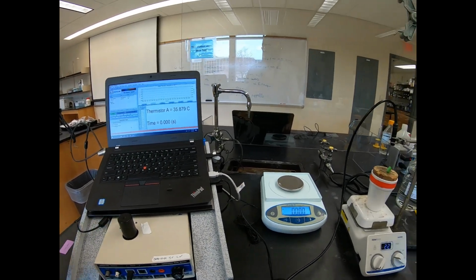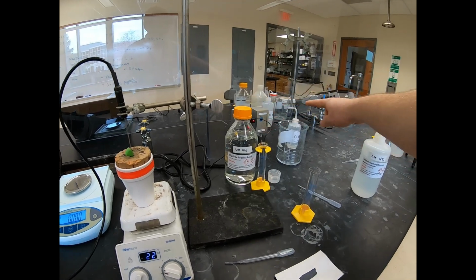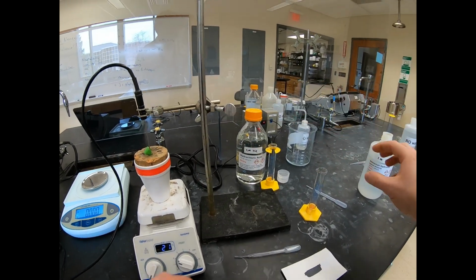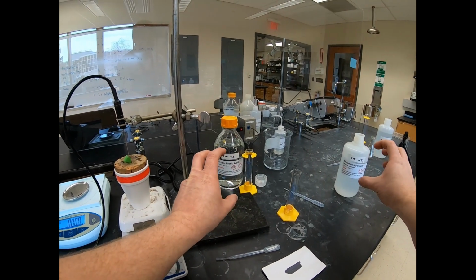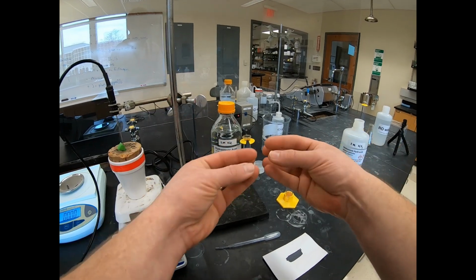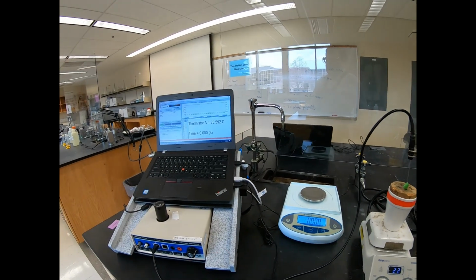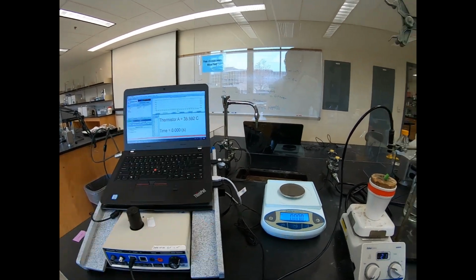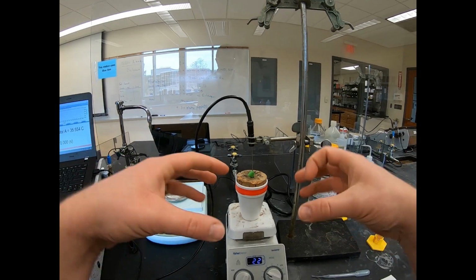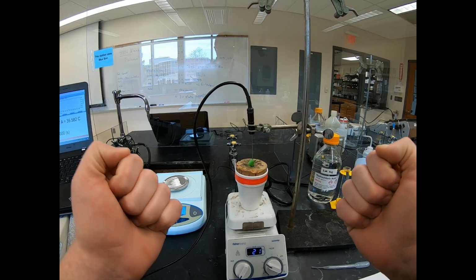So keep in mind that beforehand there's energy in the bonds of our two reactants, the ammonia and the hydrochloric acid. It takes energy to break those bonds, and as they reform new bonds, energy is released. In this case, we see that our temperature went up overall. So what that means is that there was a net release of energy. The energy absorbed to break bonds was less than the energy released when new bonds were formed.